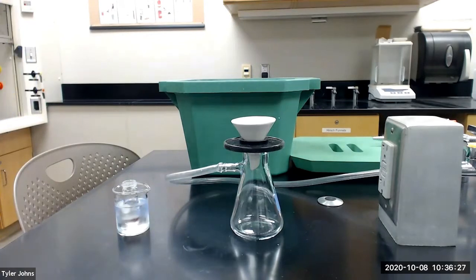We will then allow air to be drawn through our crystals for an additional 5 to 10 minutes to aid in the drying of the crystals.